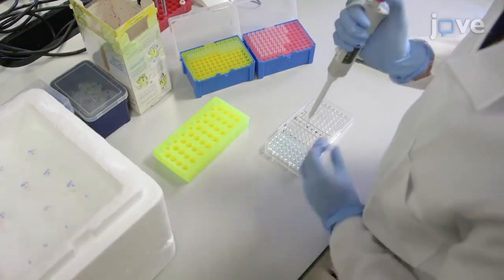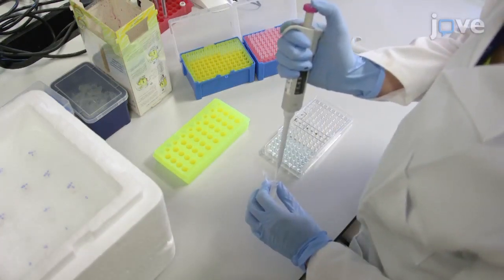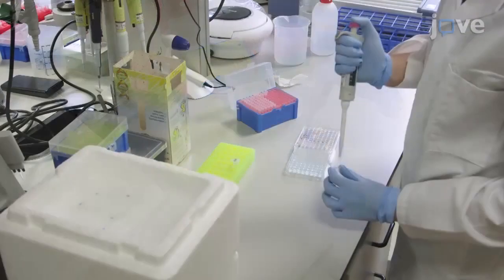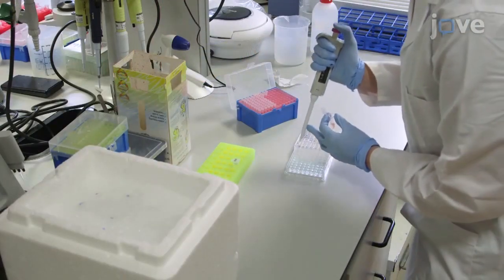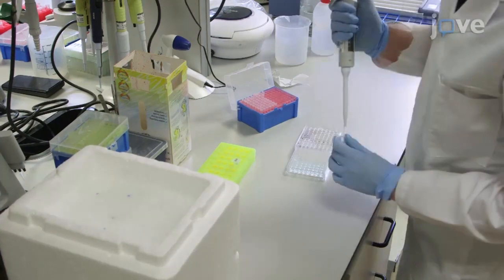For quantification of the protein concentration, set up bovine serum albumin standards at increasing concentrations in triplicate and add one microliter of each protein sample in duplicate to the appropriate wells of a 96-well optical plate.